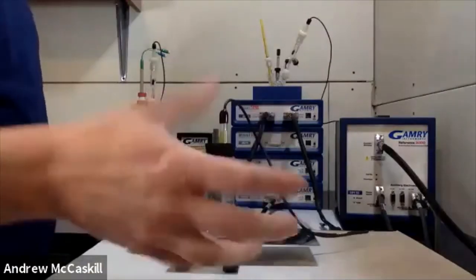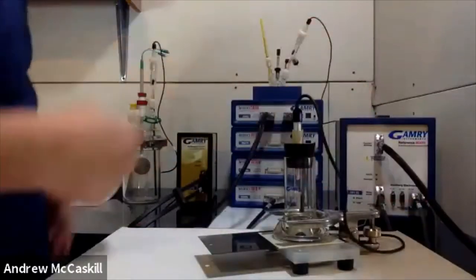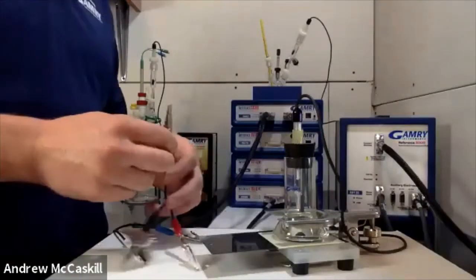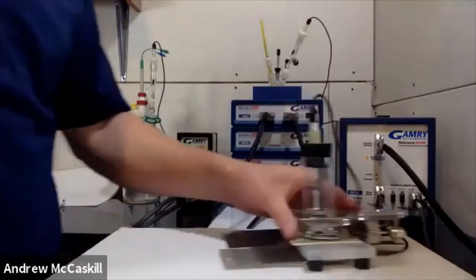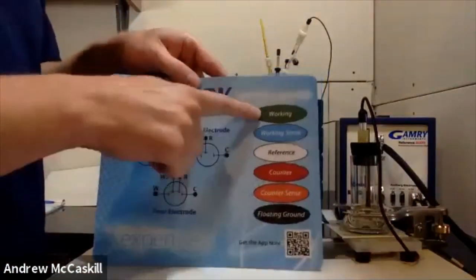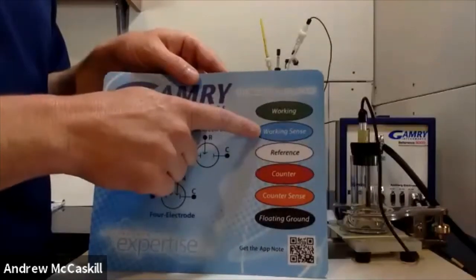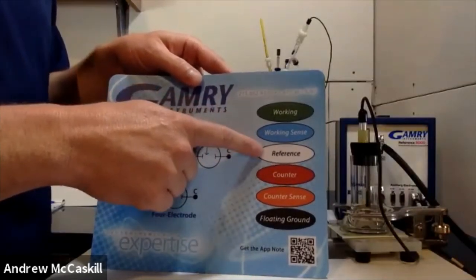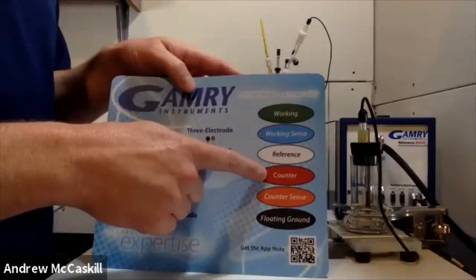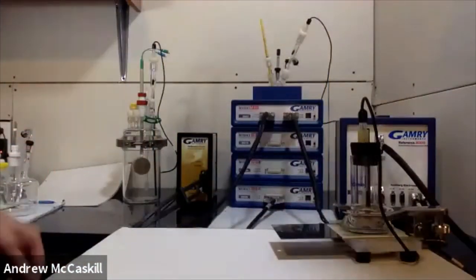Let me show you how we would connect our cables. With every potentiostat, we include a color-coded mouse pad. Green is the working electrode current carrier; blue is the working sense cable; white is your reference electrode; and red is the counter electrode current carrier. For now we're going to ignore what the orange and black are — I'll touch on those in a bit.